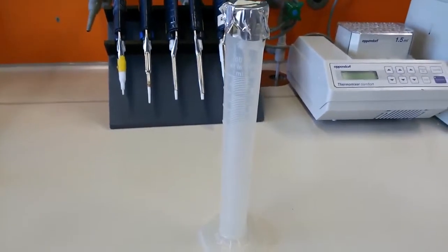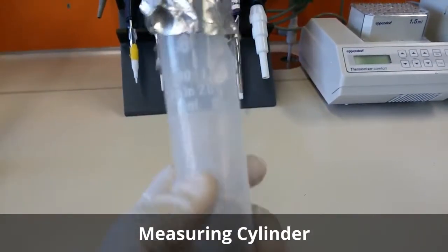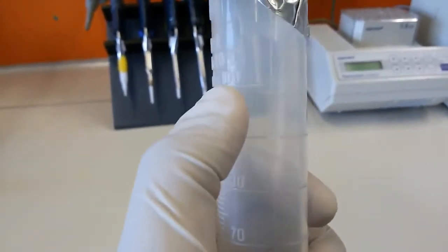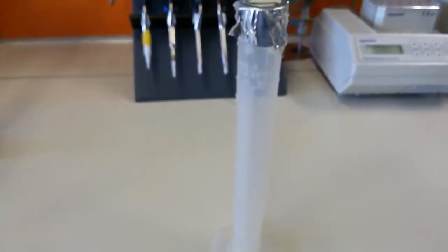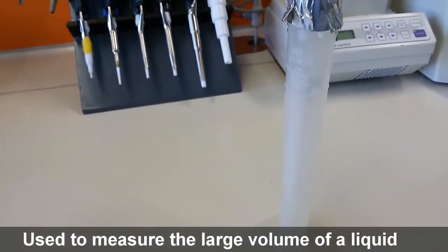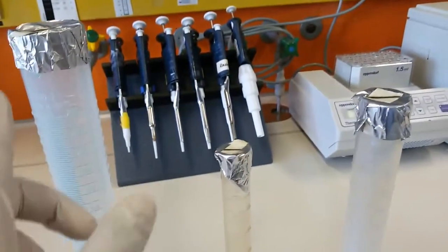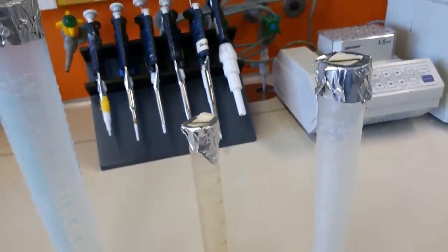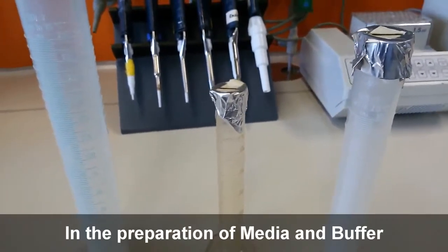So the thing that you see in front of you we call a measuring cylinder. As you can see, it's a 100 ml measuring cylinder, and here you can see 100, 90, 80, 70. So that means a measuring cylinder can be of different volume ranges. These are just measuring cylinders, and you see the aluminum foil on the top of them. They're covered, they're sterile, they're not contaminated from inside. The general operation of them is very easy.